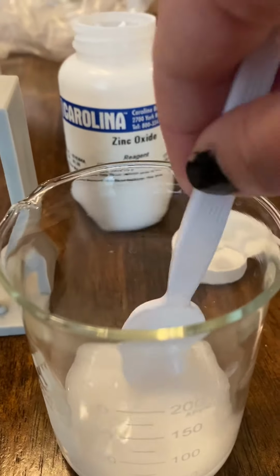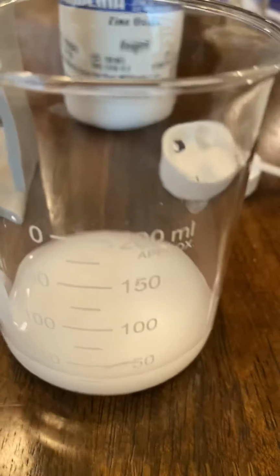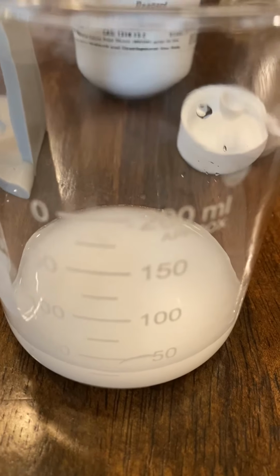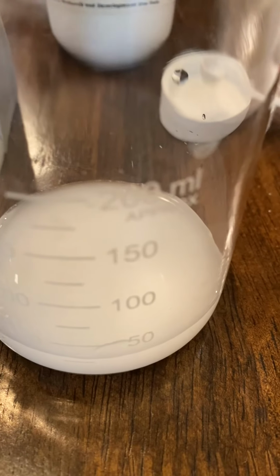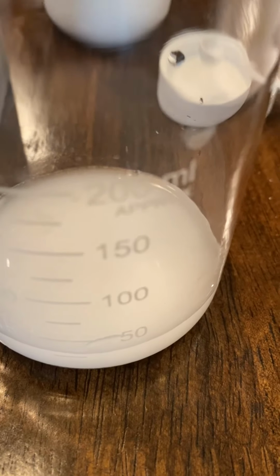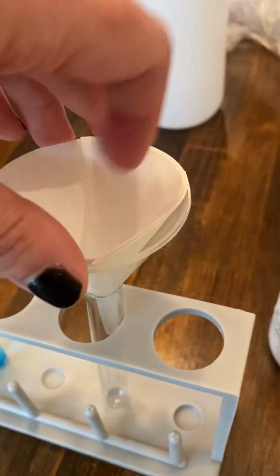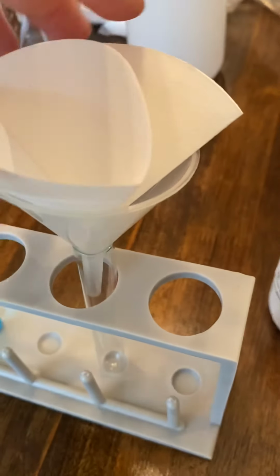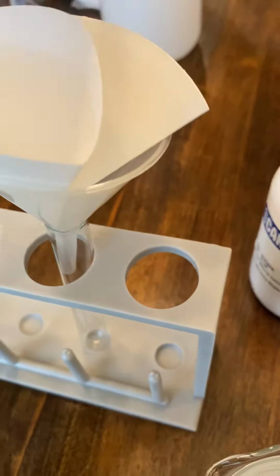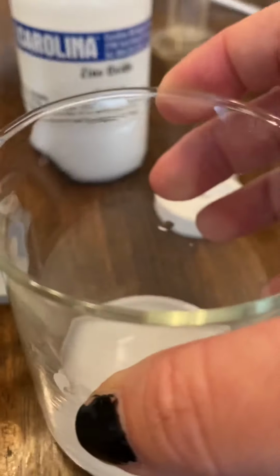Okay. So the same thing here, I want to ask you the question, what do you think is going to happen when I take this same solution, or a different solution, and this time I'm going to put it in a test tube with a piece of filter paper and a funnel in it as well? What do you think is going to happen here? So again, if you need to, pause the video for your predictions, take a look at the solution. What do you think is going to happen?